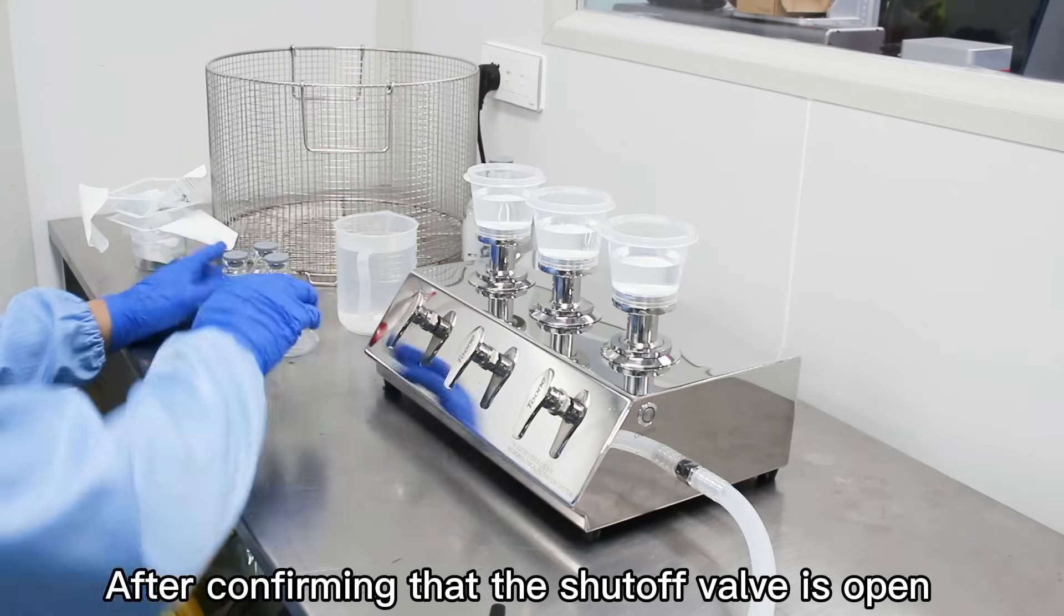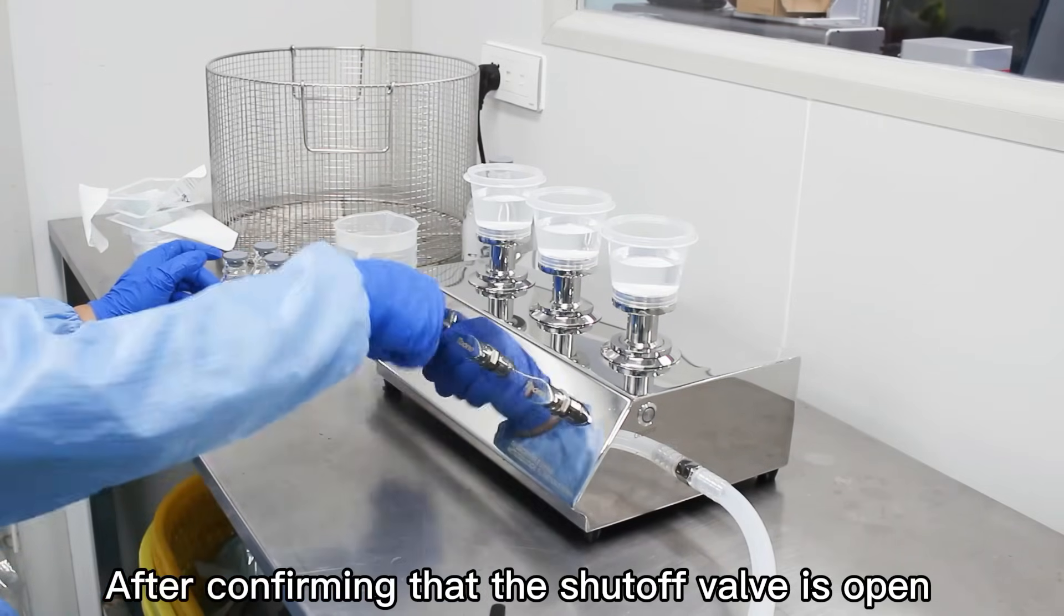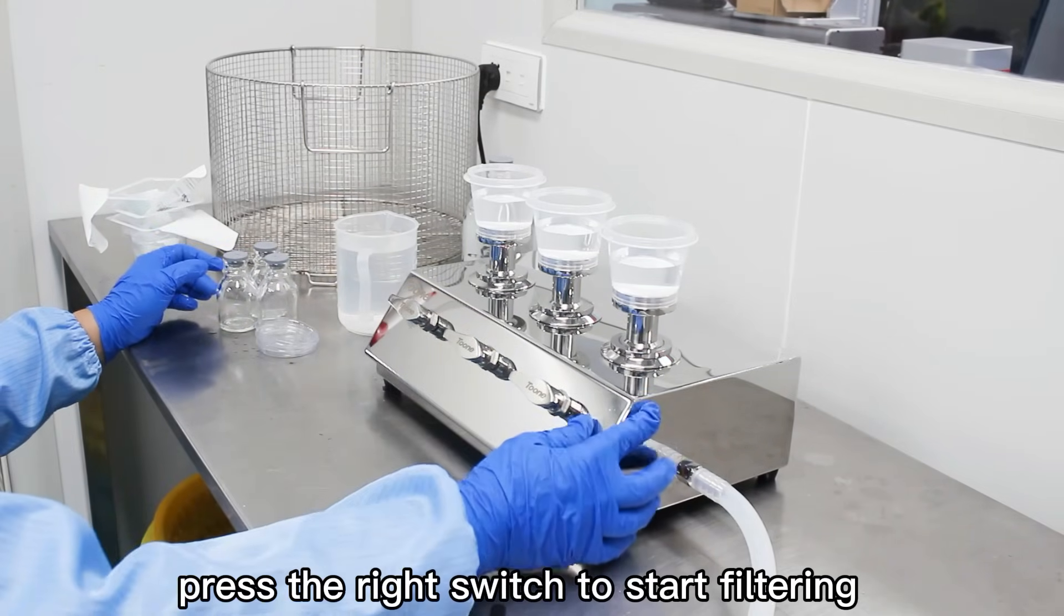After confirming that the shutoff valve is open, press the right switch to start filtering.